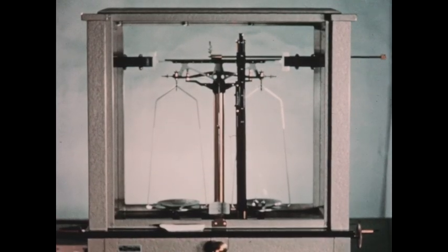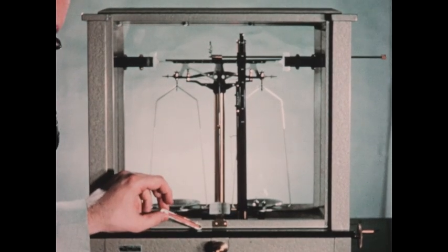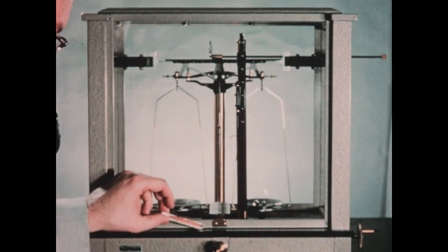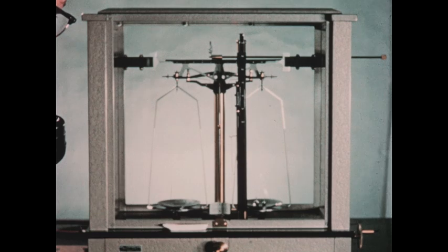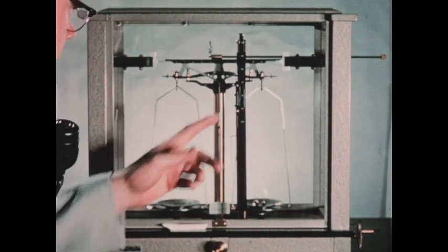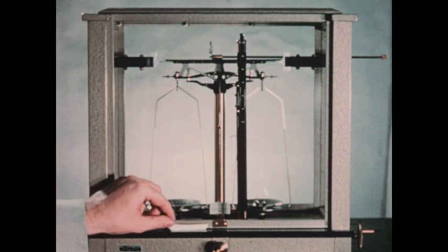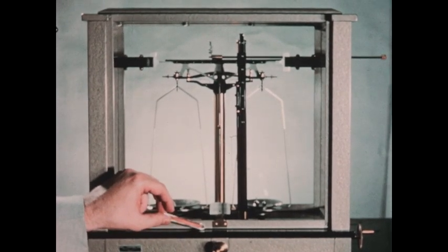We've now completed the weighing of our sample of metallic copper in the boat. All of the copper oxide has been converted to copper. We've cooled the sample, weighed it, and found that the boat plus the sample now weighs 8.3775 grams. And with this information, we can now proceed to calculate the equivalent weight, the valence, and the exact atomic weight of copper.